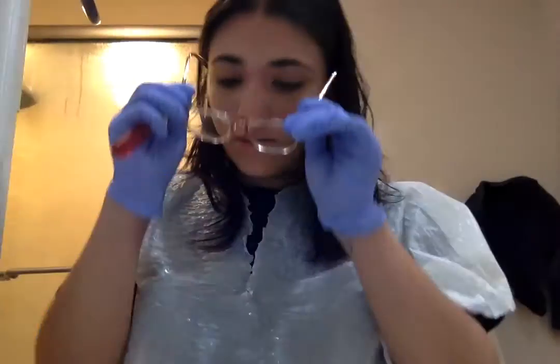Hi, today the date is going to be October 5th, and I'm going over the lab carbohydrate fermenting testing. Let me put my glasses on.